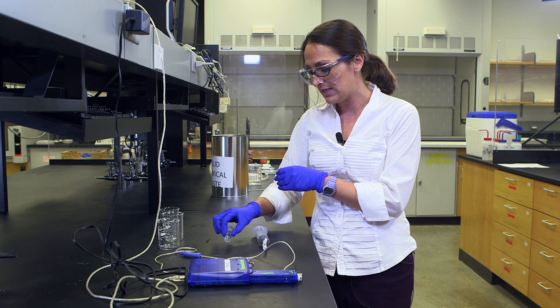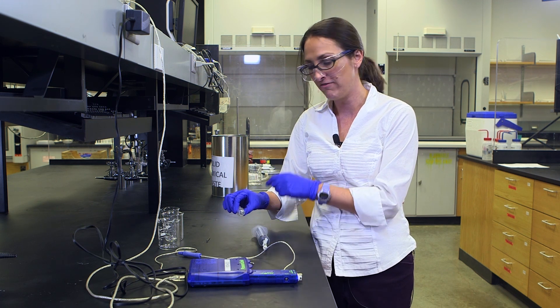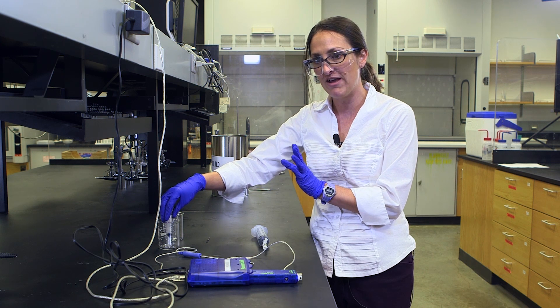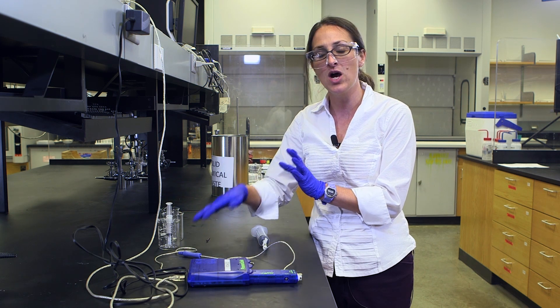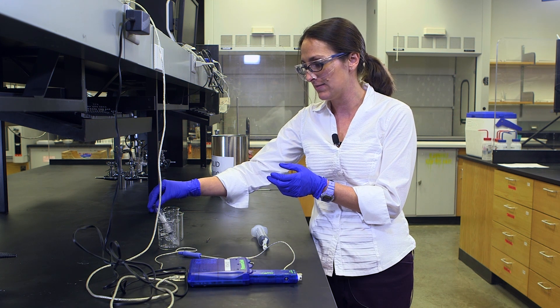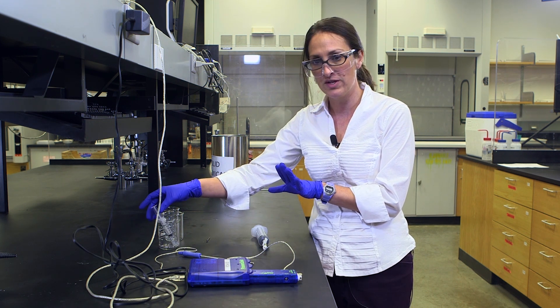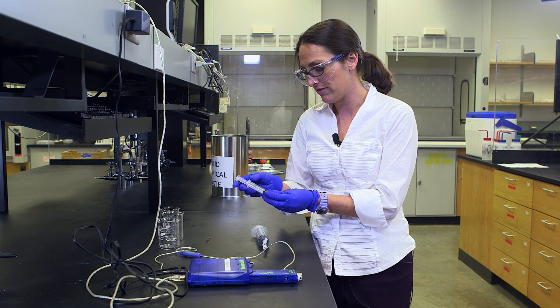We want to leave this at ambient temperature and record the volume, and then we'll put it in the hot water bath for three to five minutes. If you still have your hot water bath on the hot plate, you don't want to just set it down in there; you don't want it to get too hot. After three to five minutes, you'll record the volume.